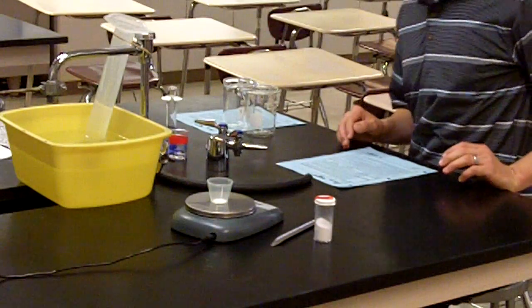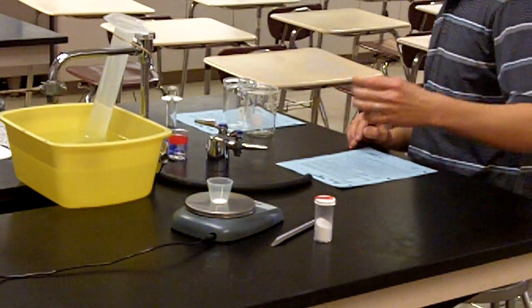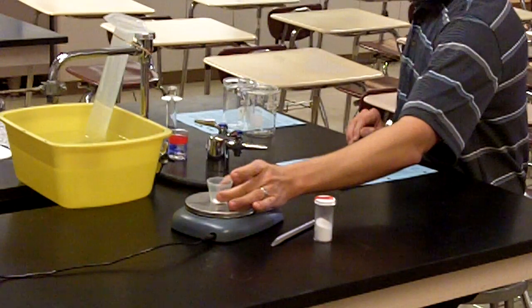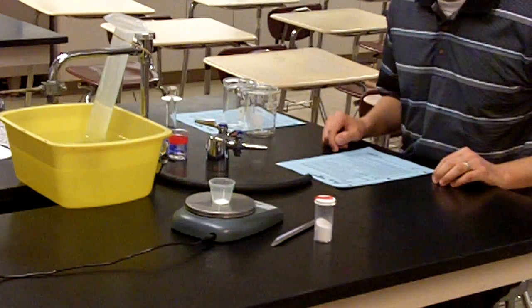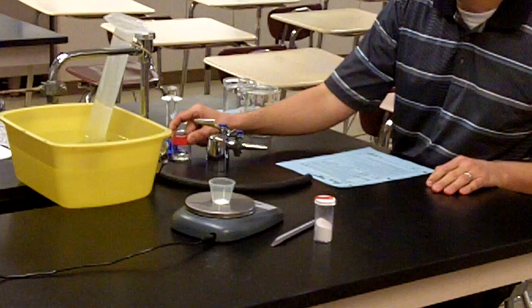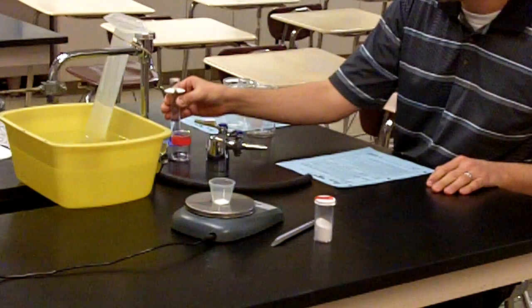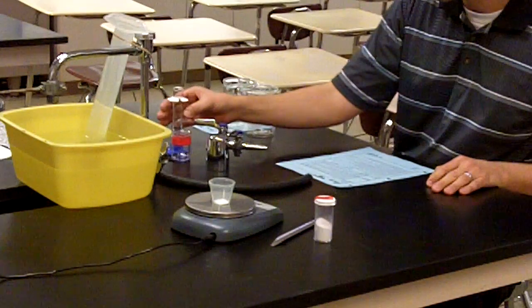Mr. Records will be assisting me here in the lab itself. What we have is the mass of the baking soda, the NaHCO3, pre-measured at 0.7 grams. We also have the hydrochloric acid pre-measured in the graduated cylinder, 12 milliliters, which the procedure calls for.